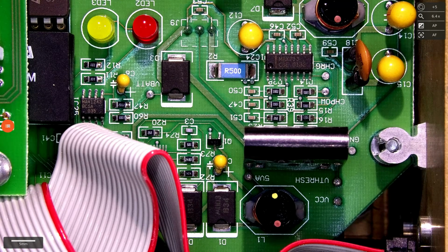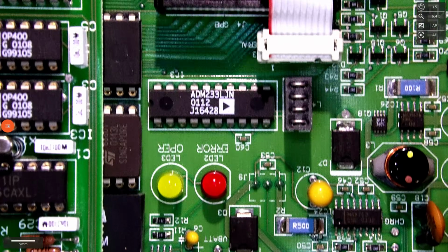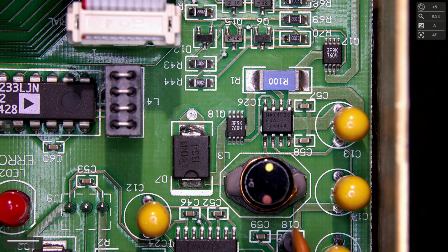Yeah, everything looks good. I don't see any immediate problems, to be honest, anywhere. There's 2 LEDs, none of these lit up when I turn it on. Everything looks good. Go over here. Yeah, all right, let's change the DC-DC converter. And here we are with the DC-DC converter, the Max 1626 having been replaced.